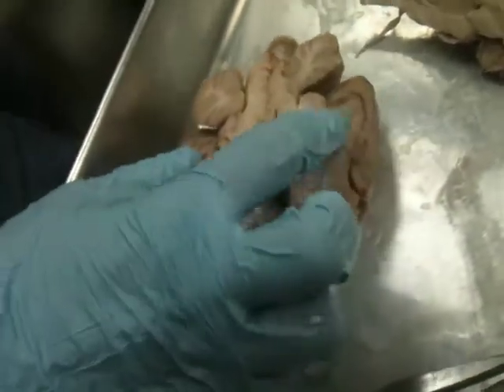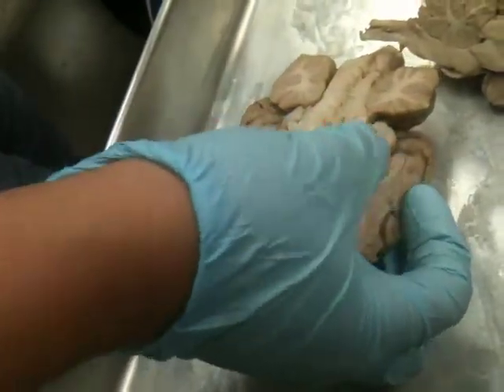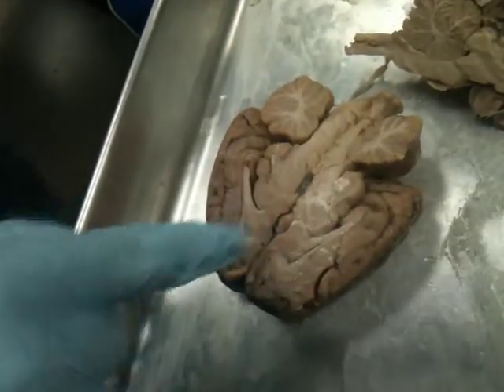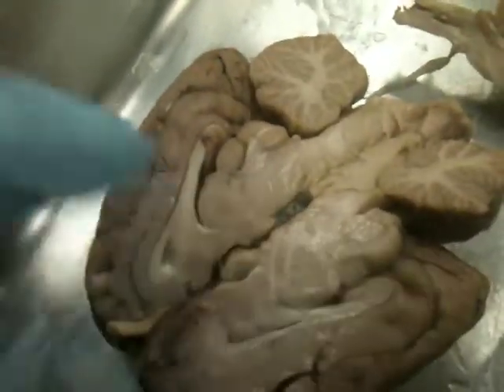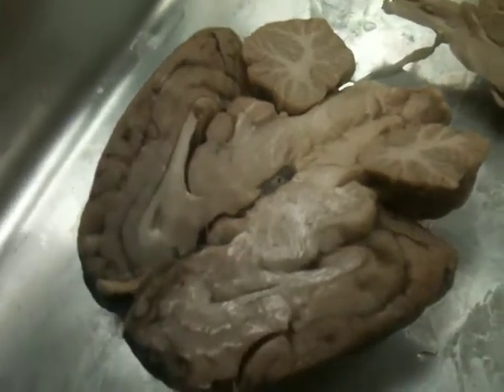Okay, so then below the lateral ventricle, you see there's a circular shaped area. That circular shaped area is the thalamus, okay? And if you look closely on some of these, you can see it's got a rougher texture on the inside of the thalamus, and that's the intermediate mass. It's essentially just the middle part of the thalamus.